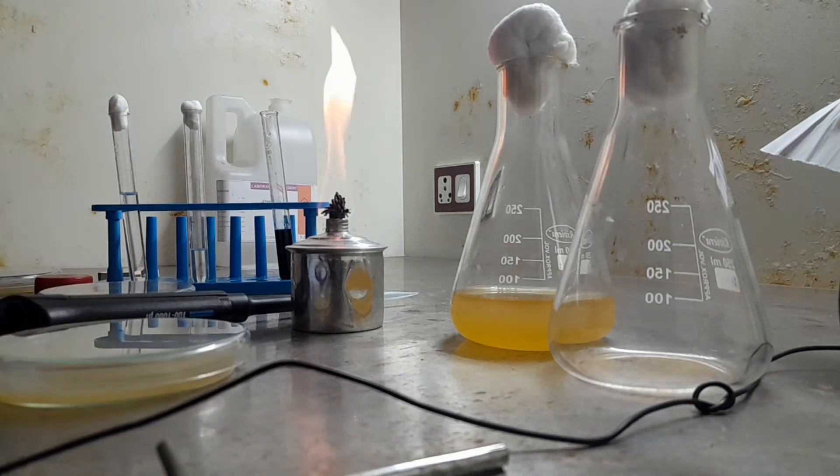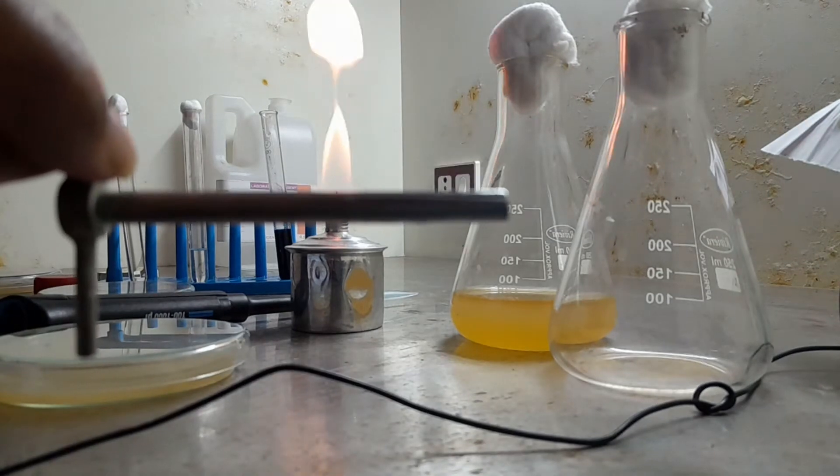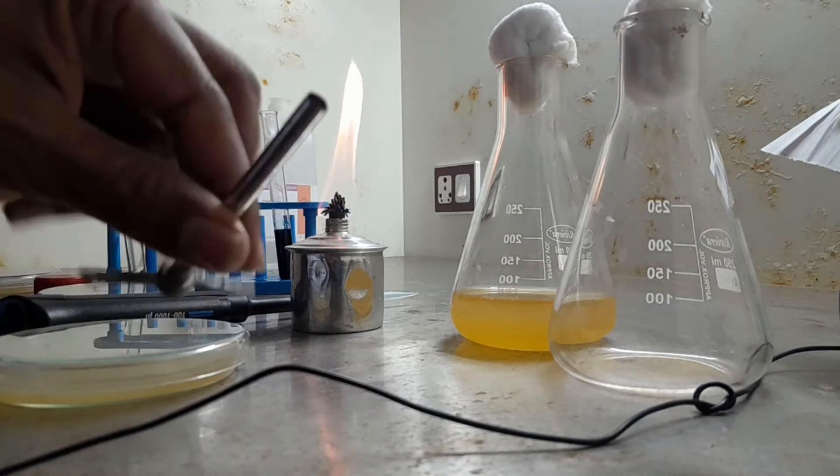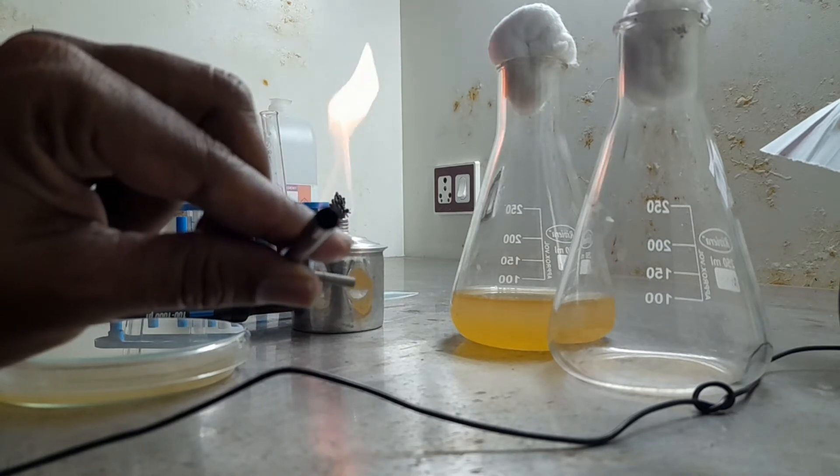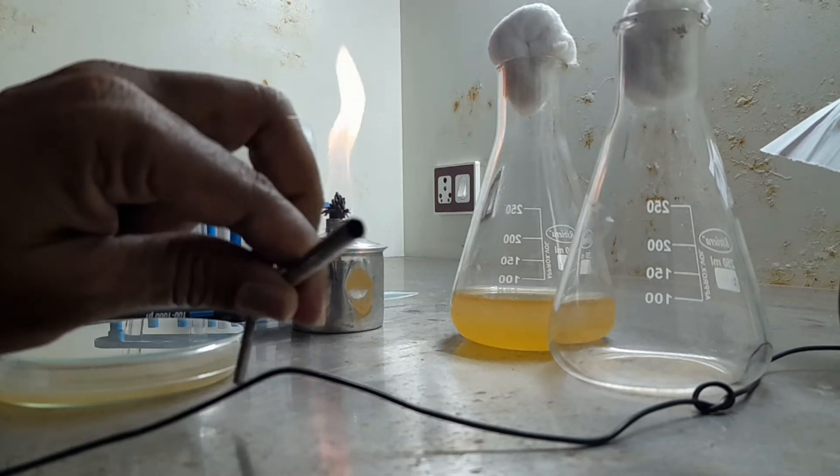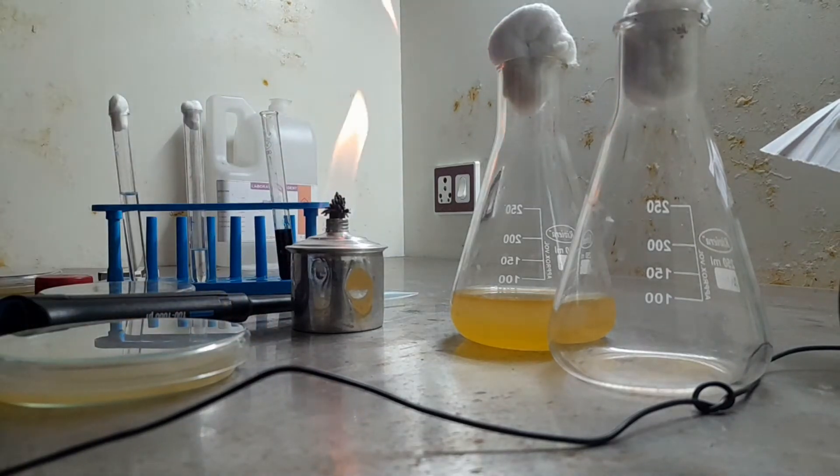Then this is the borer. This borer, what you do? Use surface sterilization. The diameter of the hole should be 6 mm minimum. It should have 6 mm, so you measure the diameter. Appropriate borer you must use.